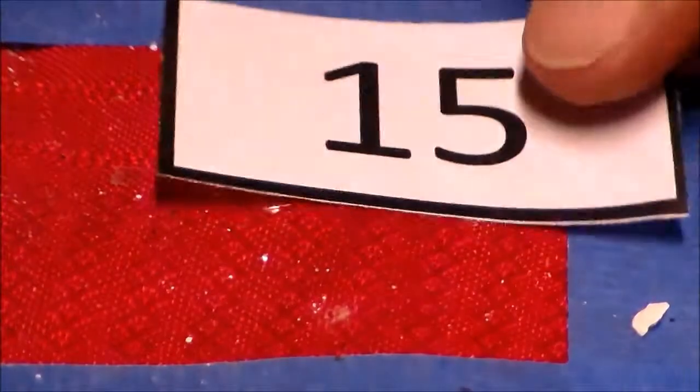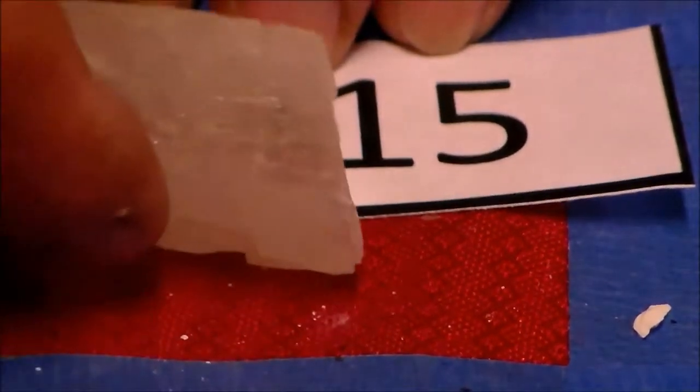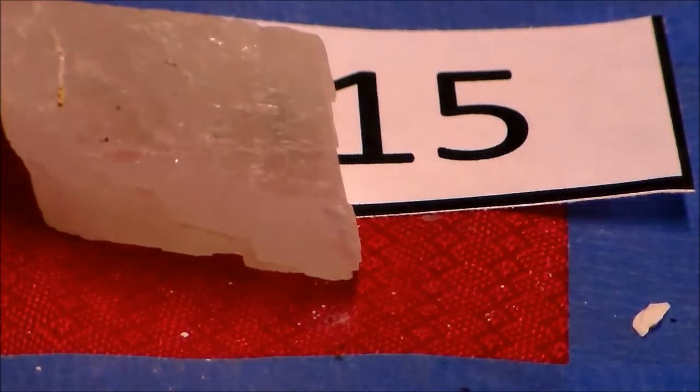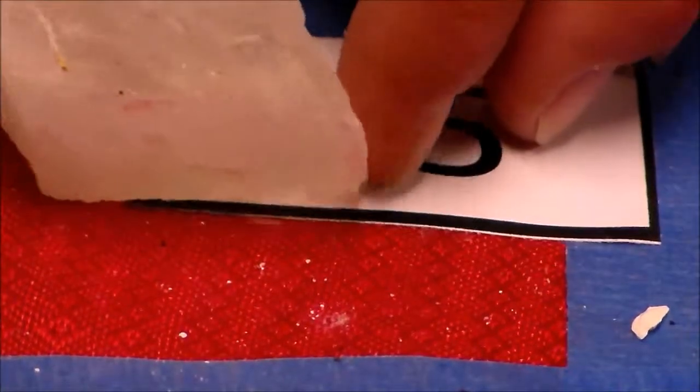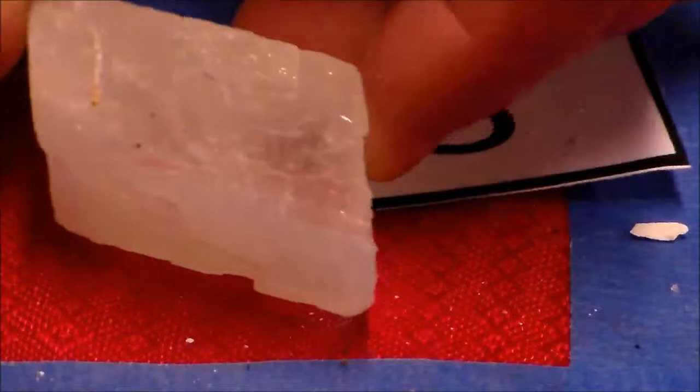Lastly, you have sample 15, and sample 15 we've looked at already. We've said it looks like a parallelogram, so we know that its cleavage is in the 75-degree angles. We know that it's colorless to white, kind of tinted color. Streak again is white. You can kind of see the powder coming off. We know that it fizzes in acid.